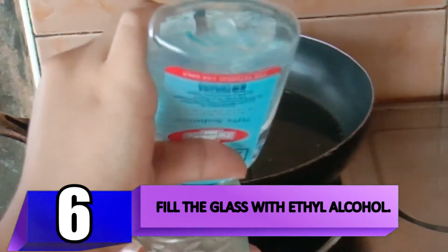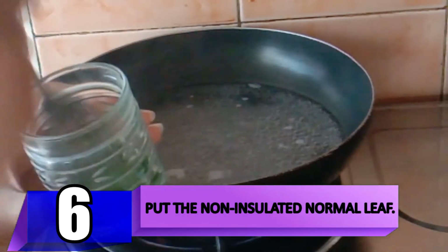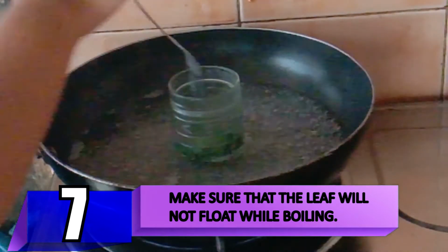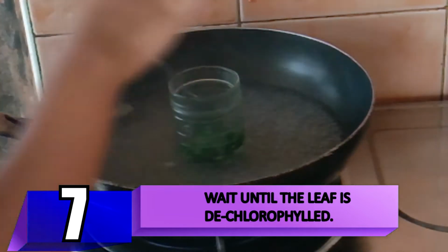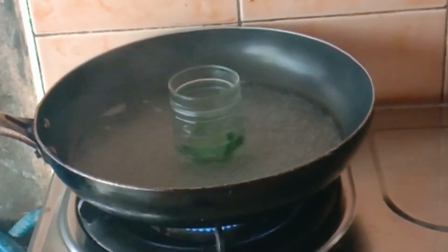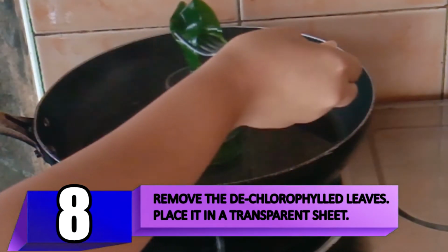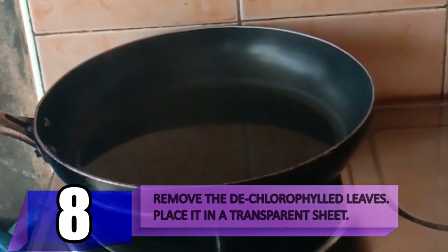Glass, fill it with ethyl alcohol and put the leaves in. After some time, remove the leaves from the alcohol, dry the chlorophyll-free leaves a little bit and place them on a transparent sheet.